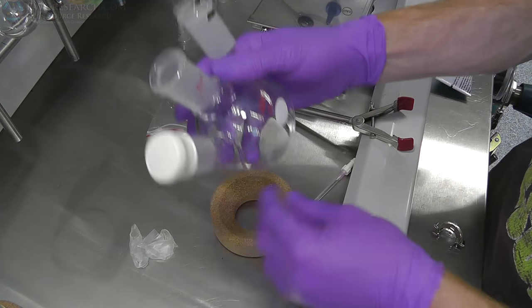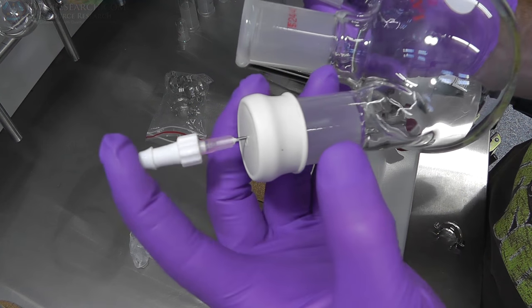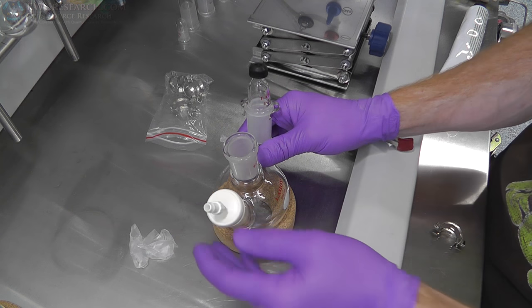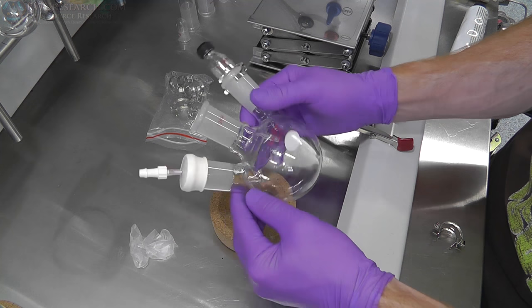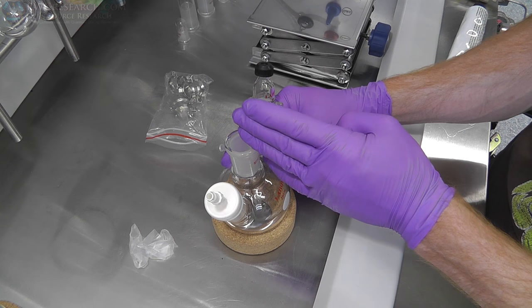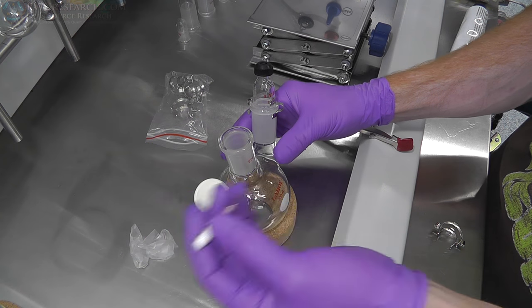So now, if we wanted to take a hose and put something in here like this, now we have access via a needle. So you can see our needle inside there. It's not a long one. So let's say we wanted to purge this system. You know, I could put in here argon and bleed it off, or I could even do other things. Or sometimes you're transferring liquids, you do it this way, and this is actually what we're going to be doing, using something similar to this to transfer liquids. So by pressurizing this container and then allowing the stuff to come out into a different container and bleed that one off, then you can actually transfer stuff. So anyway, that's a septa.